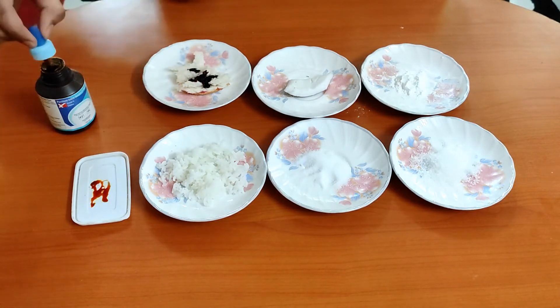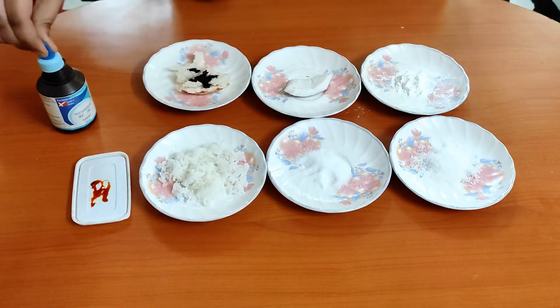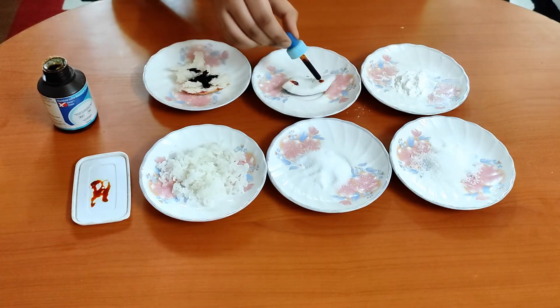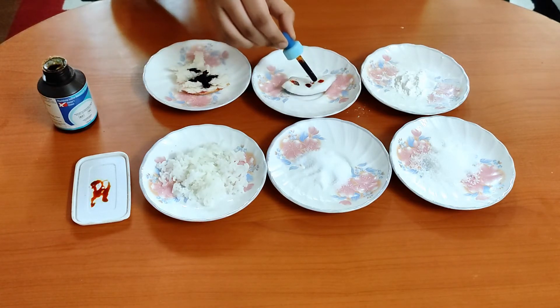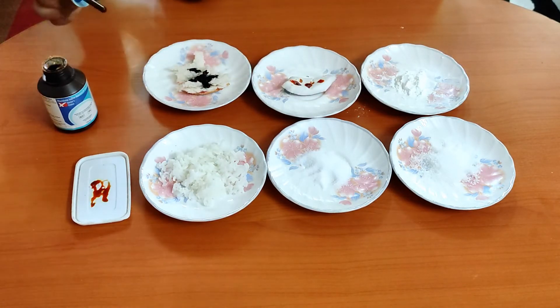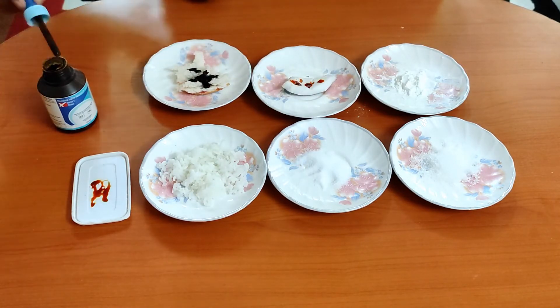Now we will put a few drops of iodine on coconut. The color doesn't change to bluish black, which means coconut doesn't have starch.